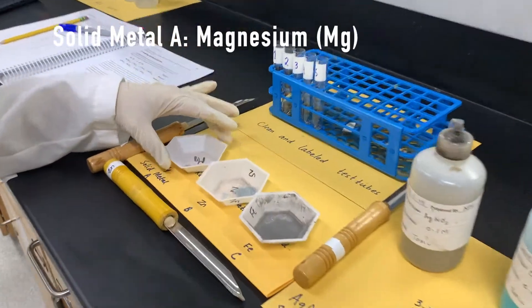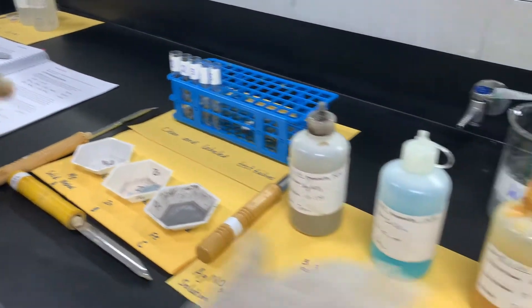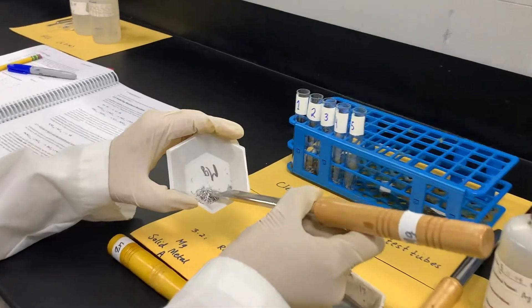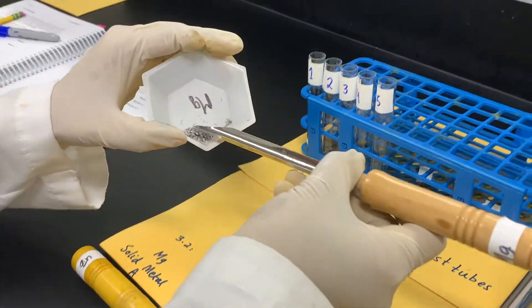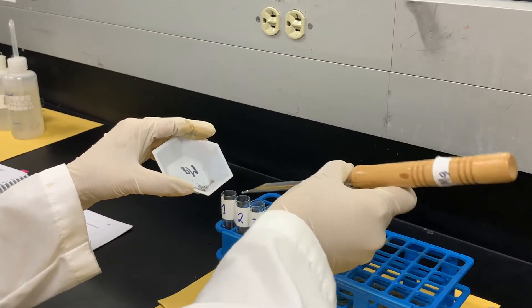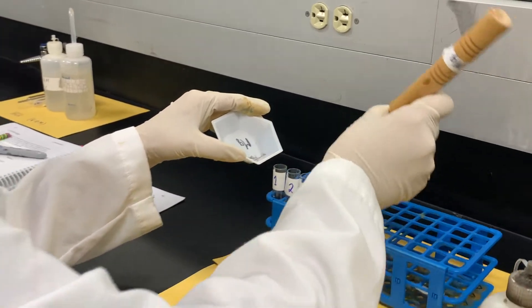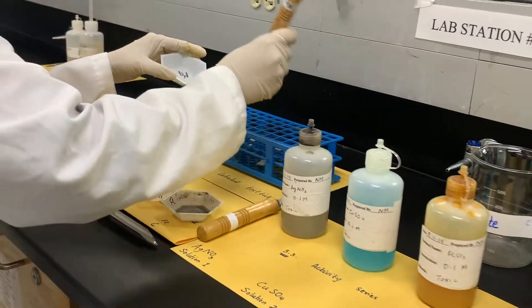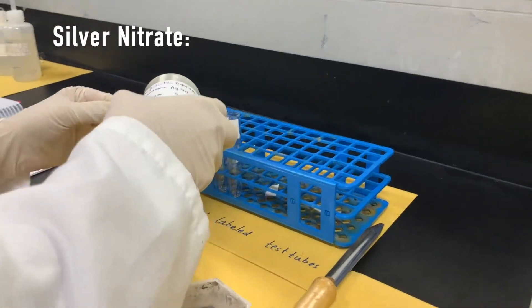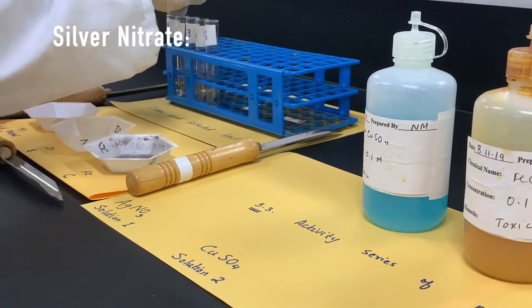Now I'm going to start the reactions with solid metal A, magnesium, with all five solutions. I'm going to place little pieces of magnesium in all the test tubes. Now I'm going to add silver nitrate solution in test tube number one — approximately 10 to 15 drops will be enough.